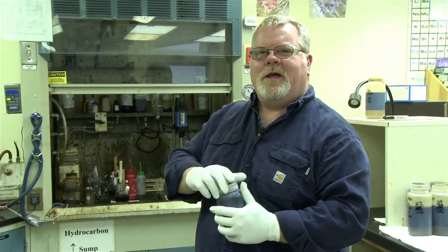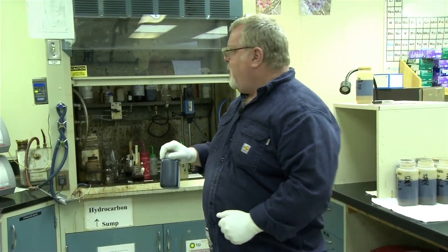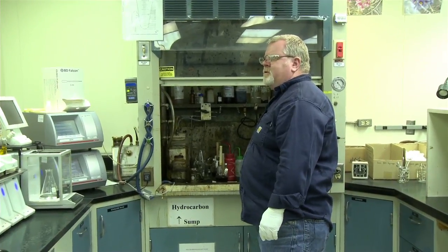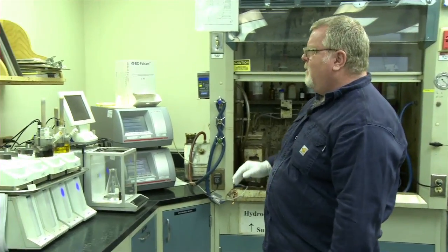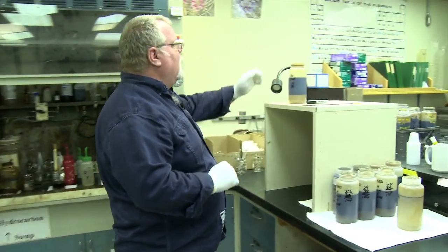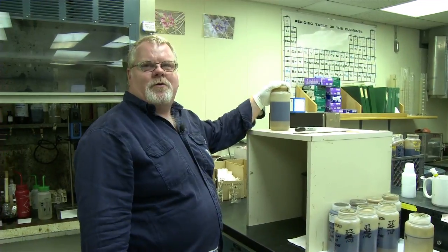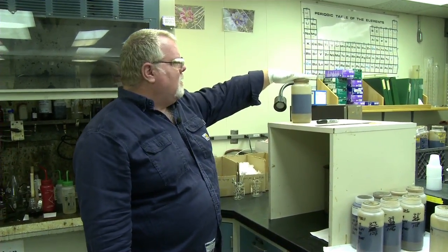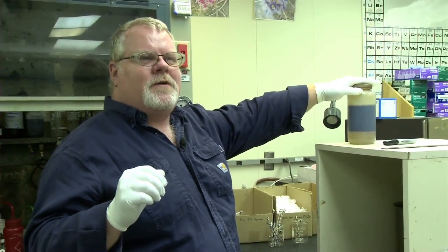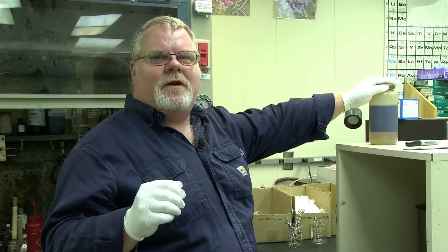This sample that I'm working on right now is Endicott transit crude, and so we monitor the water in that and what's going down the pipeline. This sample will get mixed and I'll run it for percent water and API. For the percent water, we do basically a very crude analysis. The sample gets a couple of drops of emulsion breaker, depending on how the sample is in appearance.